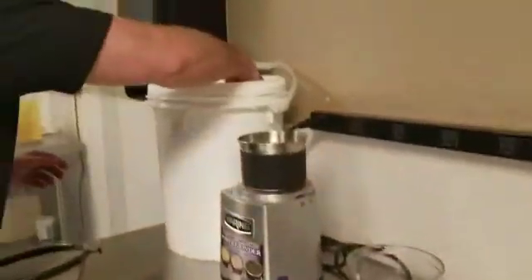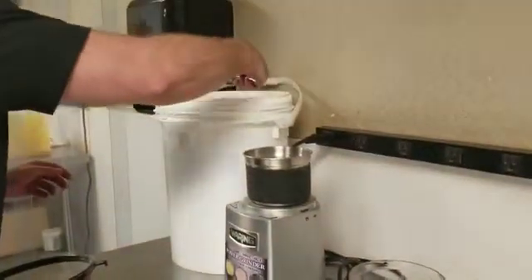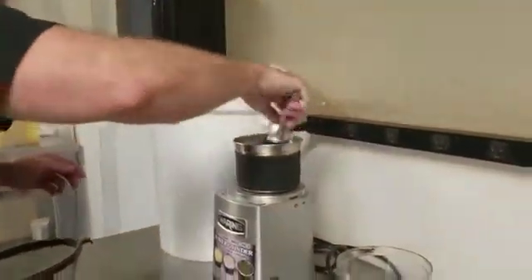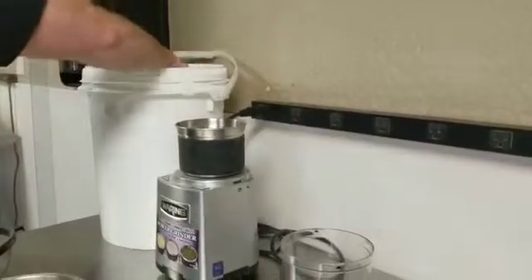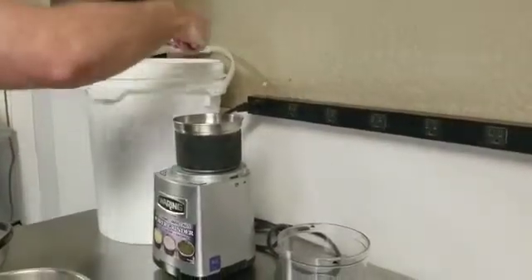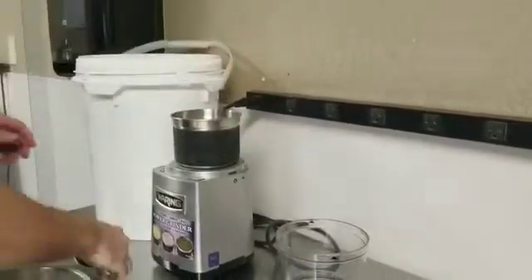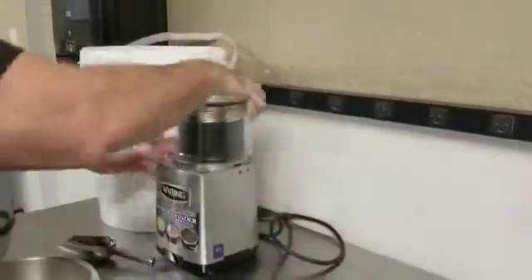So, first step we're going to get our kava. We've got to make it a homogenized sample, so we're just going to grind this a little bit.